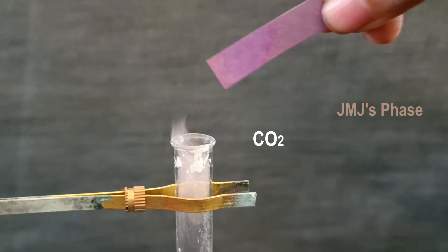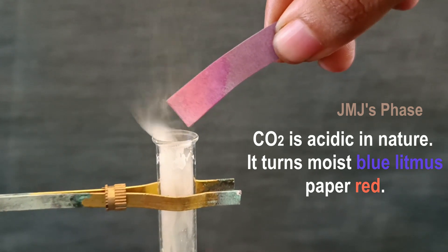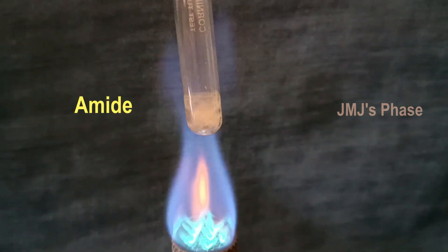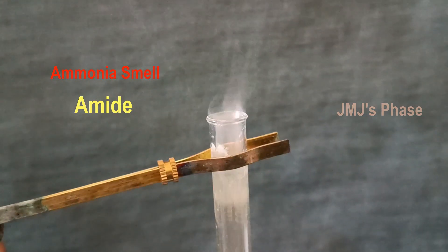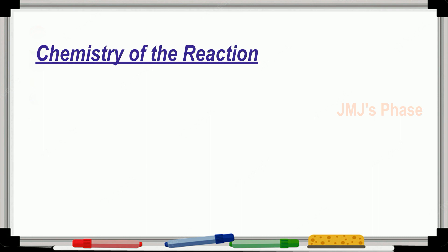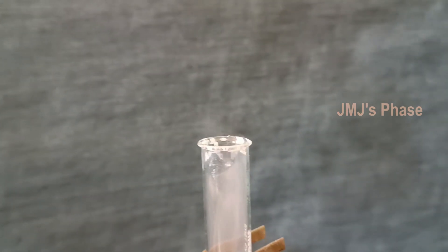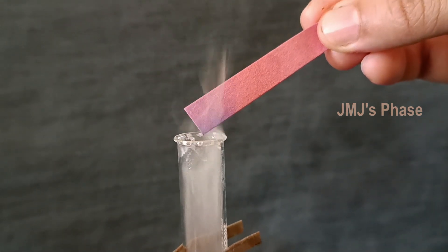The gas can be tested by moist blue litmus paper, which then turns red. If the given compound is an amide, you will get an ammonia smell instead of a kerosene-like smell. The chemistry is that amides are decomposed to give ammonia, and the gas can be tested by moist red litmus paper, which then turns blue.